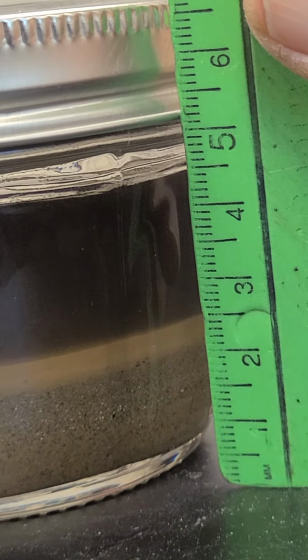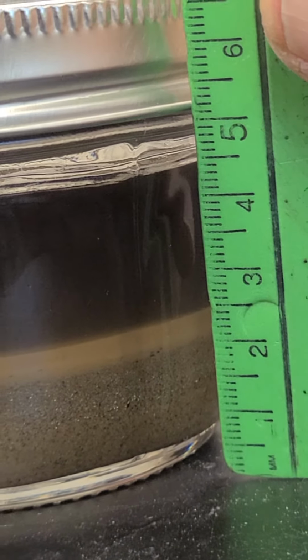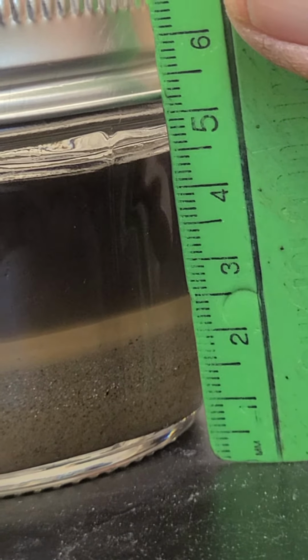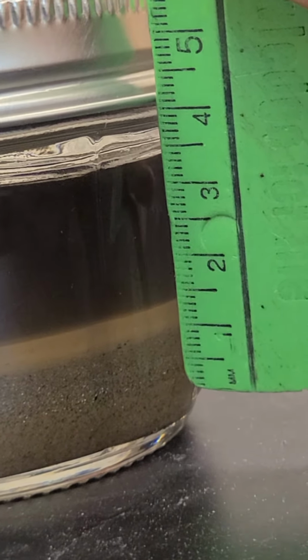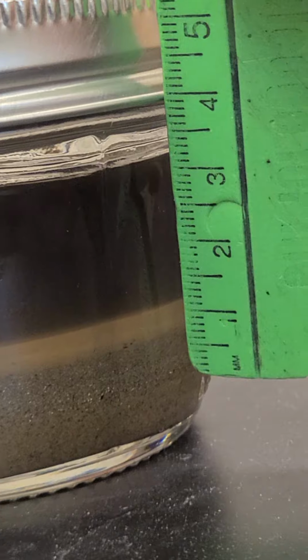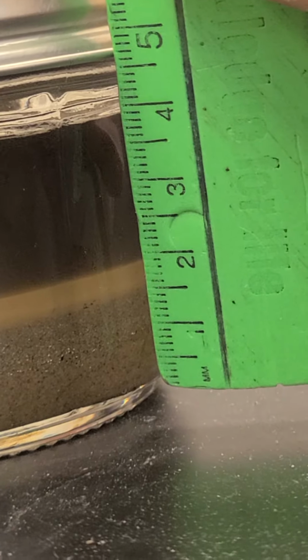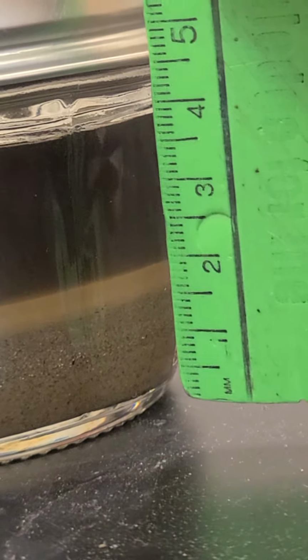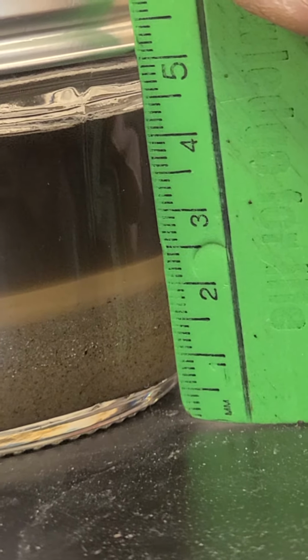And then if I count the clay part of that, I'm going to call that 4 millimeters, okay? And then I'm going to measure the silt layer, and it's a best guesstimate, I would call that, let's go here actually, maybe a little easier to read, I would say that's about 7. So I had 4 and 7, that's 11. That would leave me approximately 14 millimeters of sand.